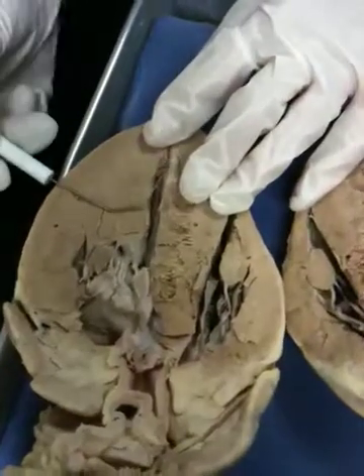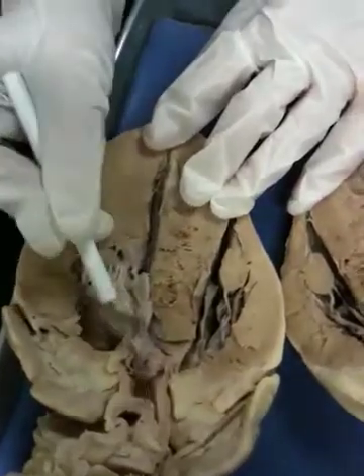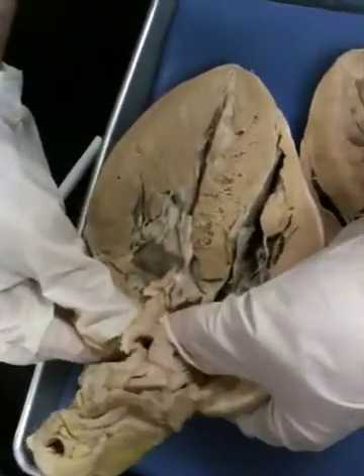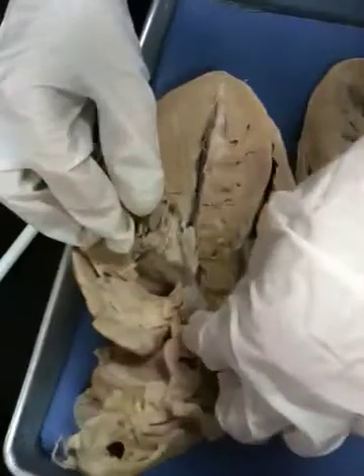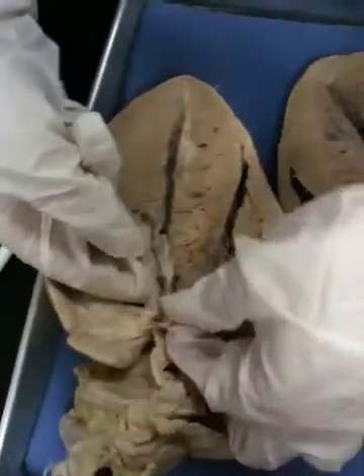From the left side, the left ventricle is going to pump blood into the aorta, so it's pretty much right here — we know it's the aortic. We can travel from the ventricle up there. The walls are really thick and durable; they feel like industrial rubber band. You can see a nice aortic semilunar valve there as well, and this is real thin but still durable — I can pull on it and it's not going to rip off.